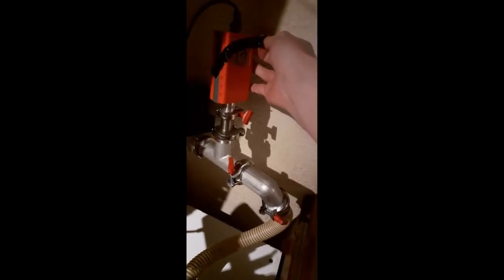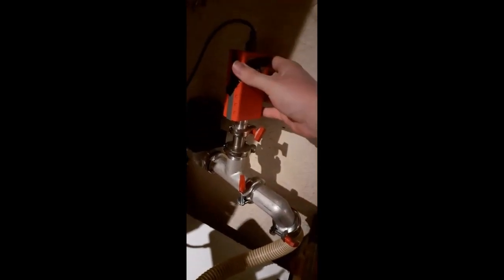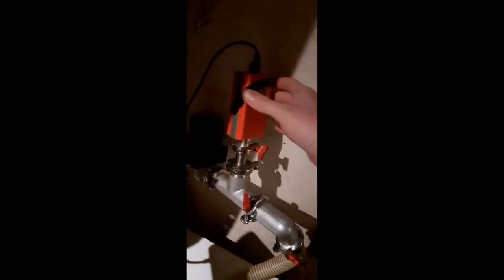Then we have a vacuum gauge here. This is an Edwards APG active Pirani gauge, and this is just a complete unit. You just give it 24 volts and it gives you a 0 to 10 volt output. So it's very easy to interface. And some more flanges here, some more hose here. I've decoupled these two, I'll tell you why later. And this then feeds into the turbo pump. This is the output port of the turbo pump.